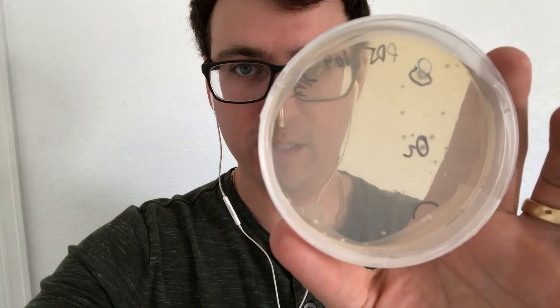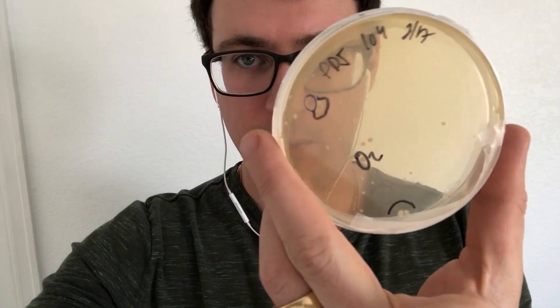What's up guys, it's Gary with Fresh From the Farm Fungi. I'm here in Denver and it is day six on our breeding project. We're starting to get a lot of isolates so I labeled a couple of them.